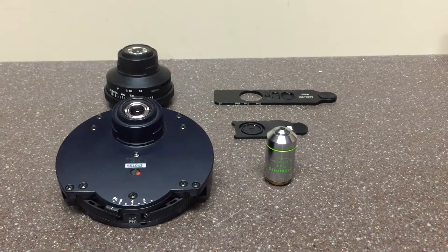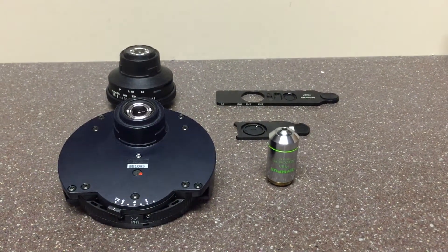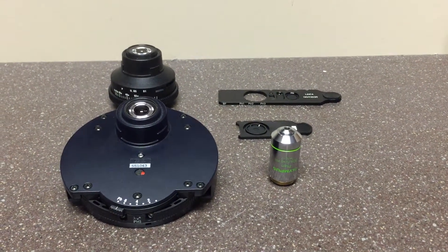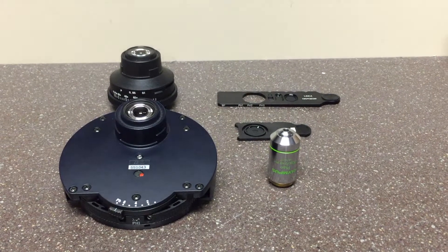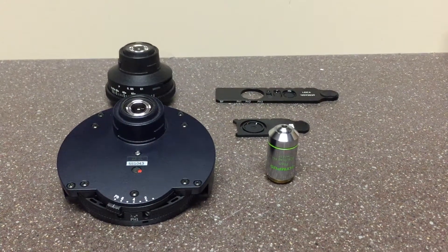Microscope Central offers a wide selection of phase contrast microscopes. Phase contrast microscopes will help you view unstained specimens.